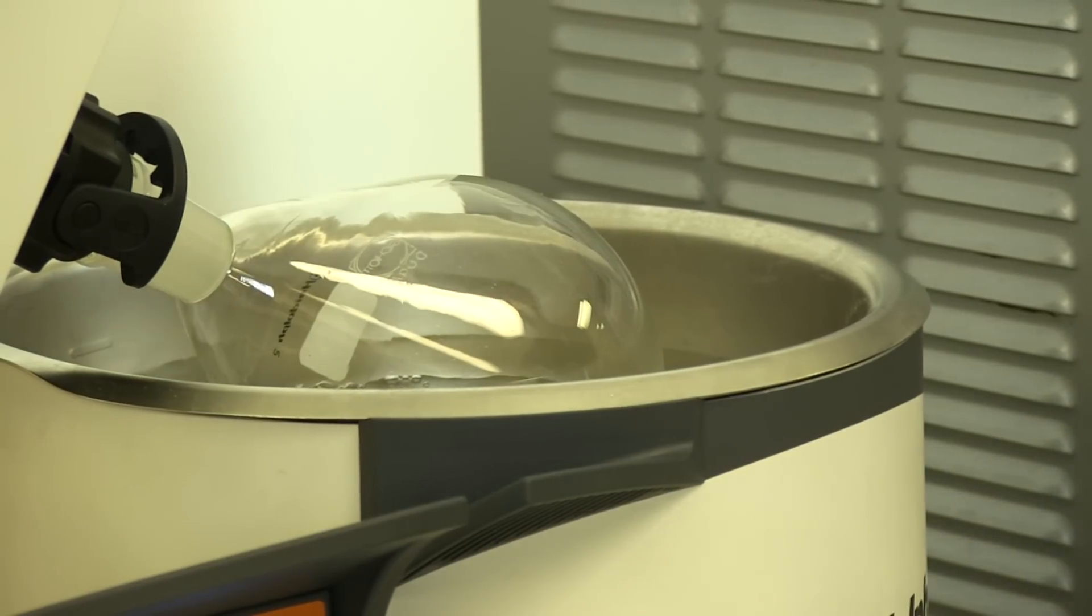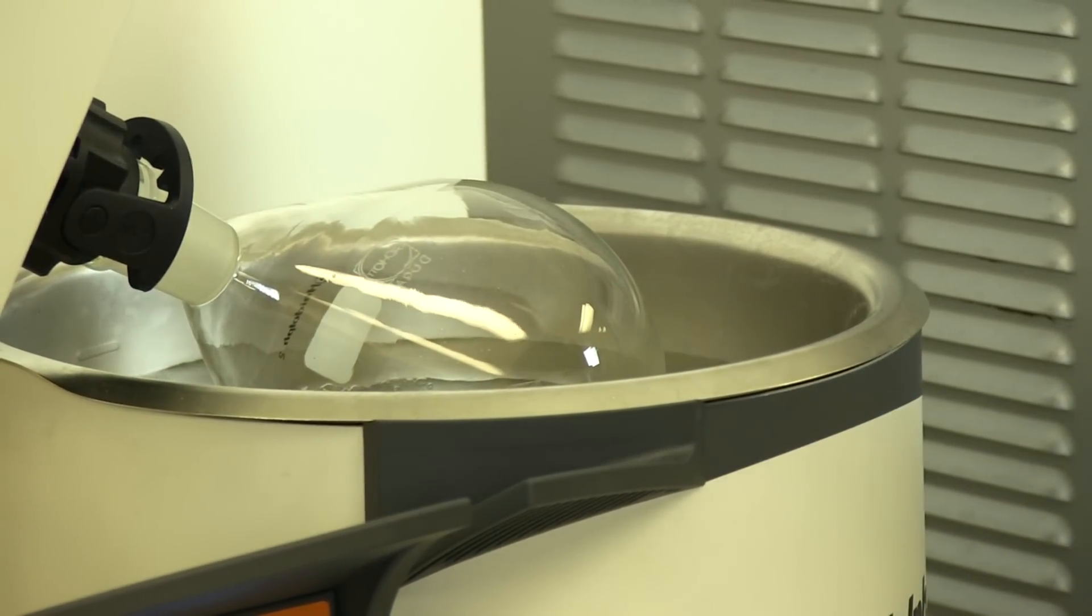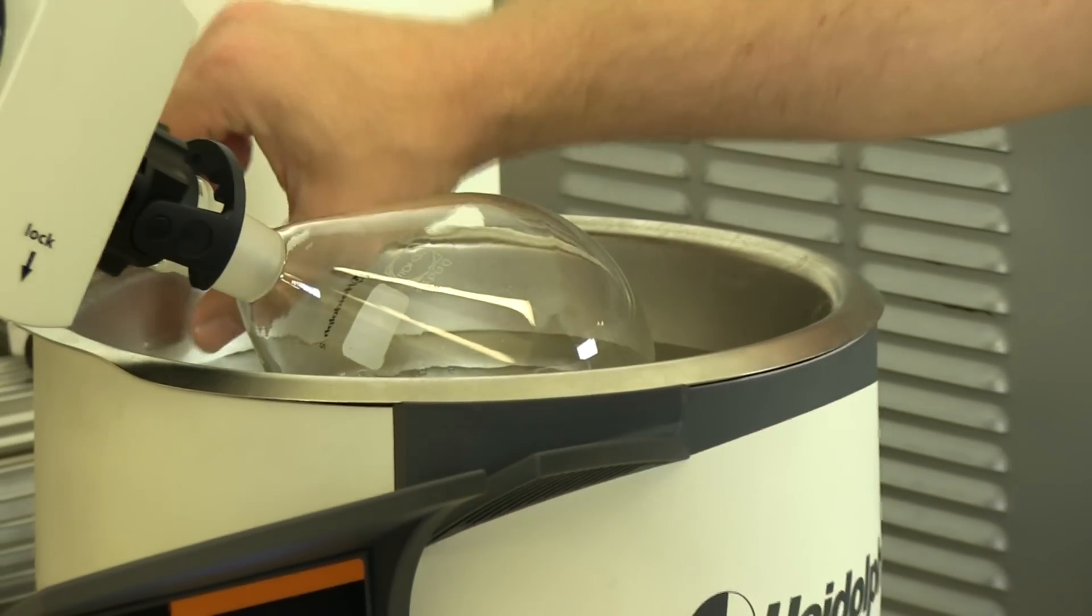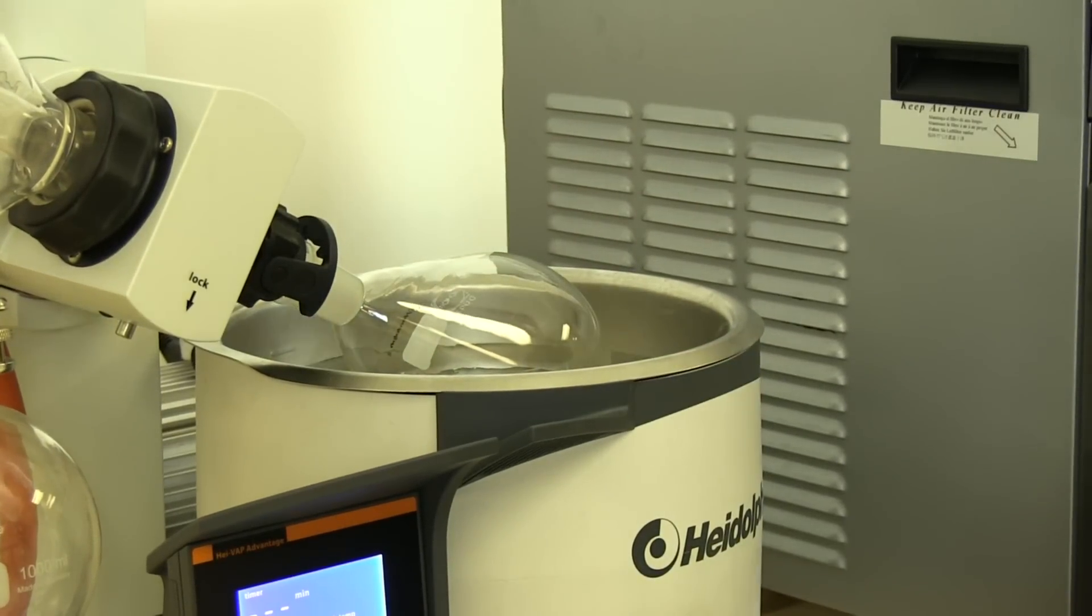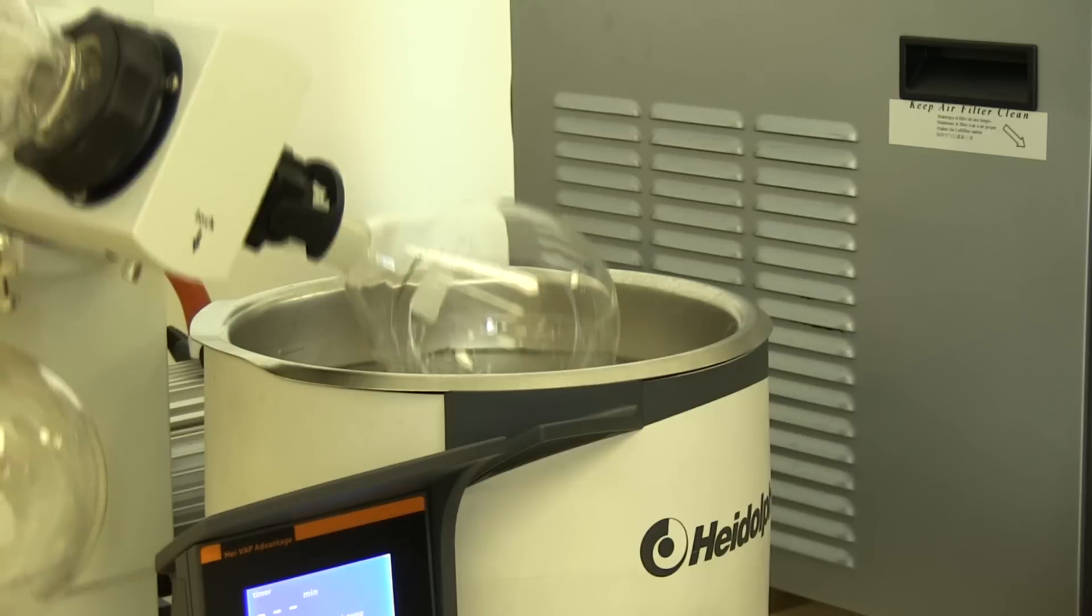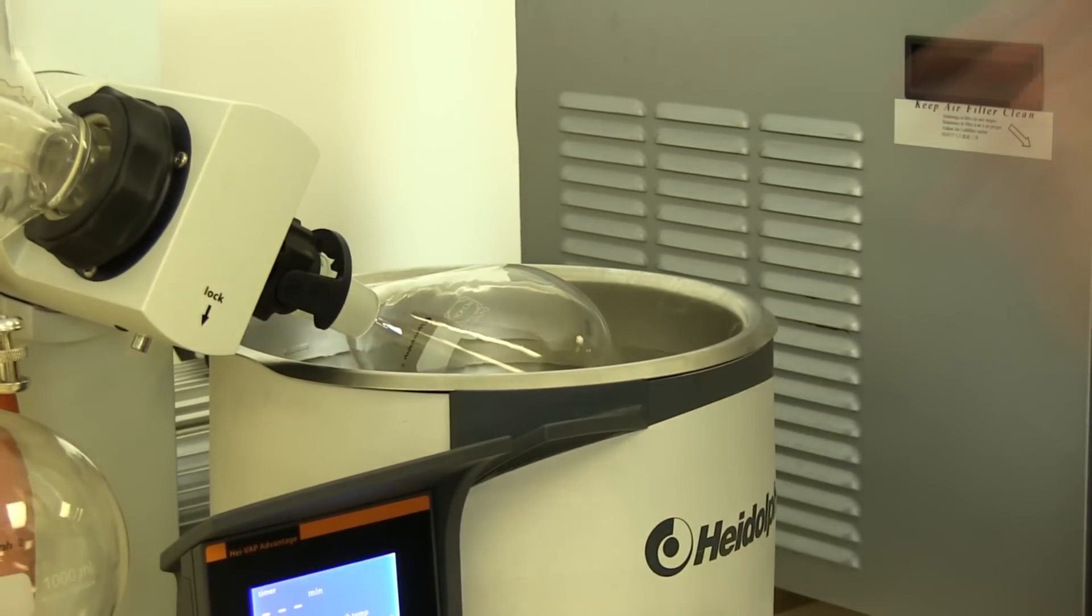About 1 gallon or so is what you need to get the proper level. On the rear, you see a minimum and maximum, and when you raise and lower, you'll see the displacement take place.